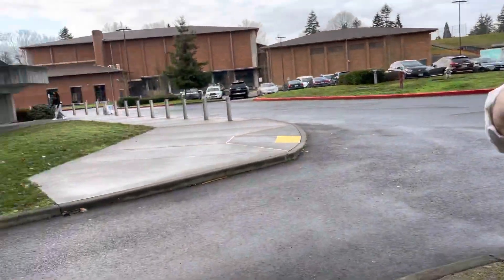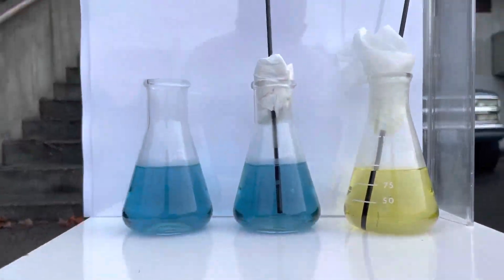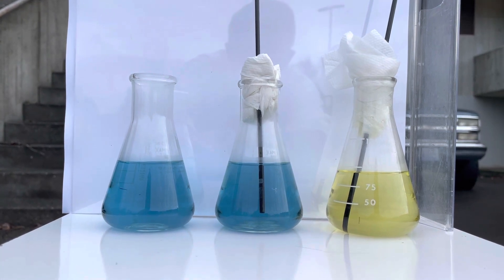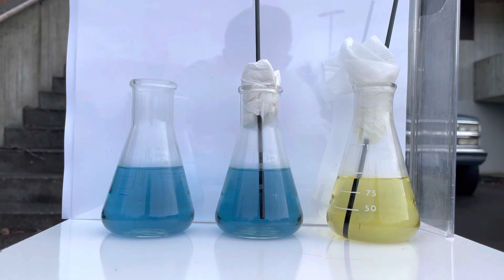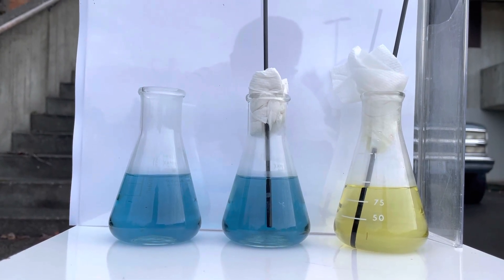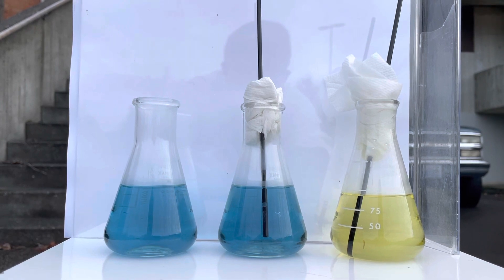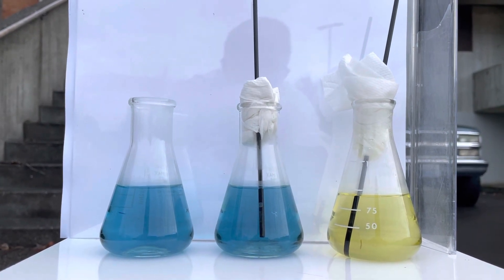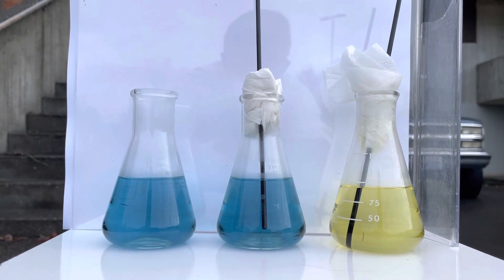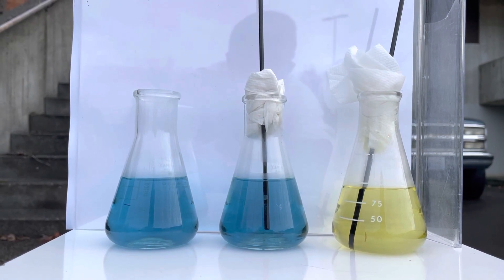We are practicing safe distance procedure. Here we've got a setup — we have three beakers of BTB. The one on the left is our control; it's going to stay blue. The one on the right is yellow — we've already blown into that BTB for a long time, and because we have carbon dioxide in our breath, it turned yellow. Mr. Matty is going to blow into the middle one three times: one time with no exercise, then after running up and down the stairs for a minute, and then after a second minute of running.